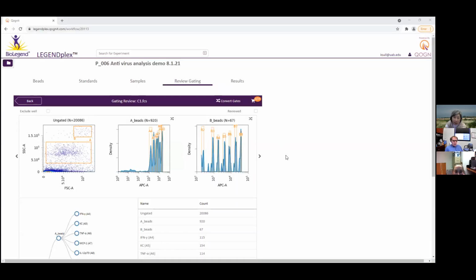So the thing is, this looks like it's done, I see from the top, with LegendPlex software. And so, of course, we agree that this is the right way to do it. And we don't want to just review gating, as you have underlined there. We want to move things around. Right, so that's what we did.